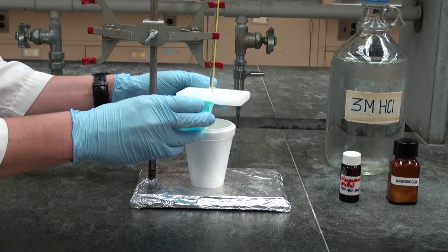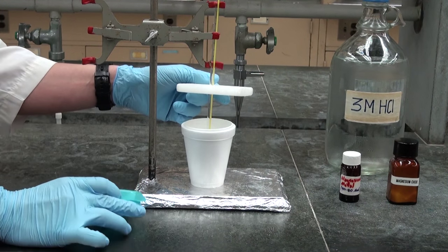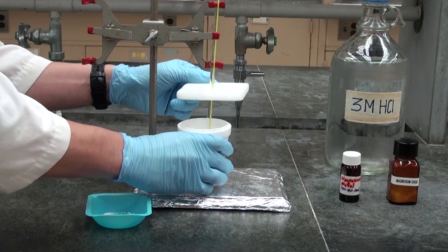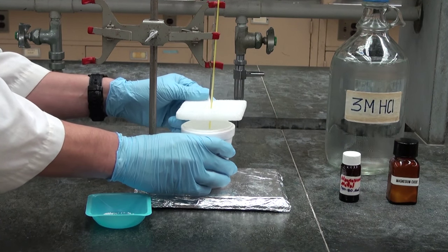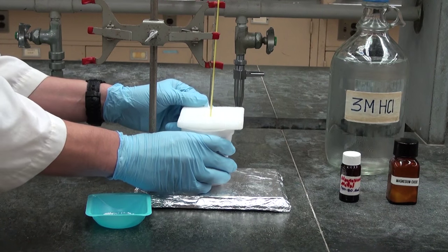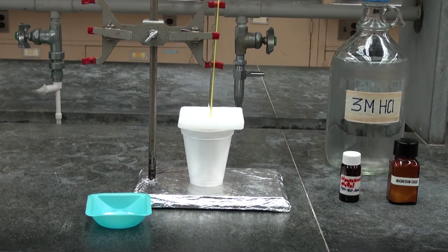Be sure to do this quantitatively to make sure we add all of the magnesium oxide. It's then good practice to stir the solution to make sure everything mixes together. We should record the temperature from the thermometer every 20 seconds, and we should do that until the temperature starts to go back down.